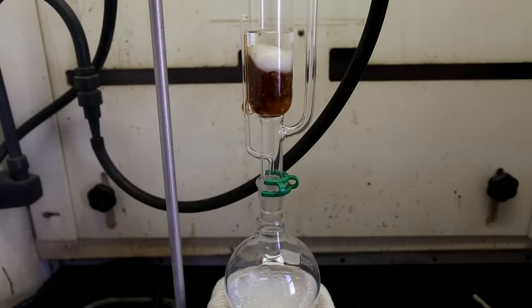Unfortunately, the angle that I chose to film this on makes this quite difficult to see. So to make the functioning of the Soxhlet extractor more clear, I have taken a diagram from Wikipedia to help.